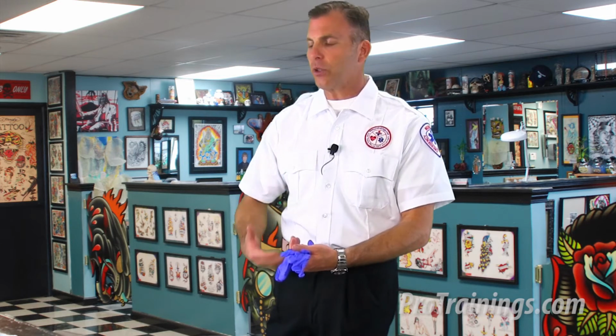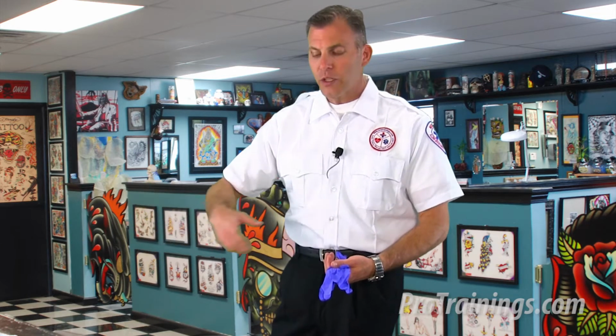I'm going to make sure that I've got at least a few pairs of gloves because we want to remember that we're going to be changing our gloves every time we might touch contamination and then go to a clean object. So when I first do the first wipe down, I'm going to throw all that away, put new gloves on properly, then grab my bleach solution, spray down the surface, wipe it down, throw that away, take off the gloves appropriately, and then put on a third pair of gloves to grab the bottle and spray down for our wet to dry disinfecting time. And you'll see that as we go here in how I'm going to display this.